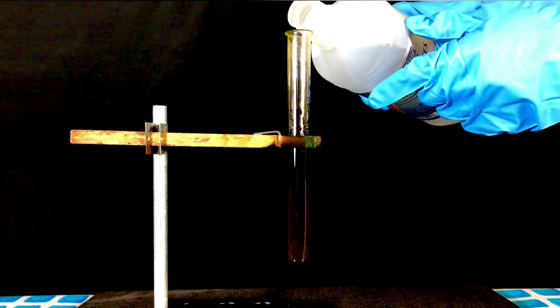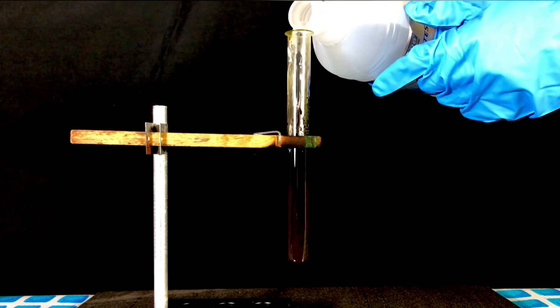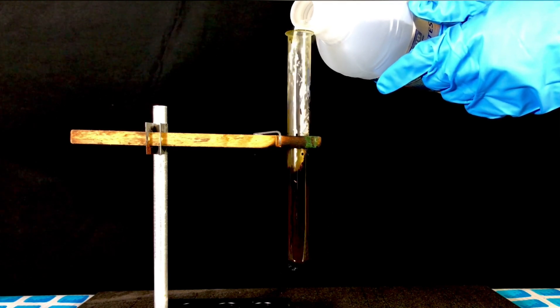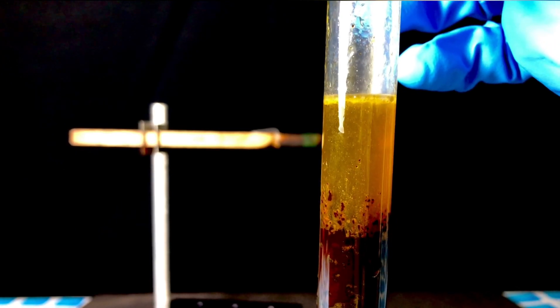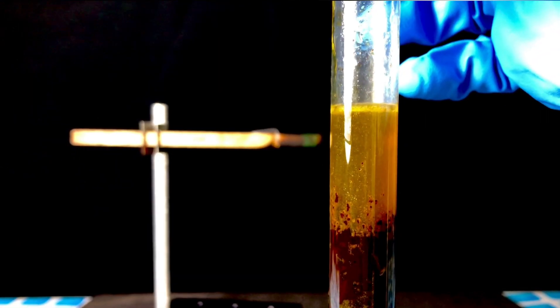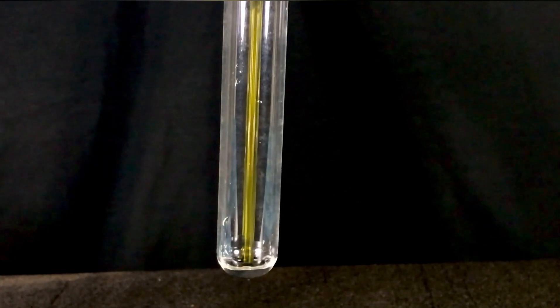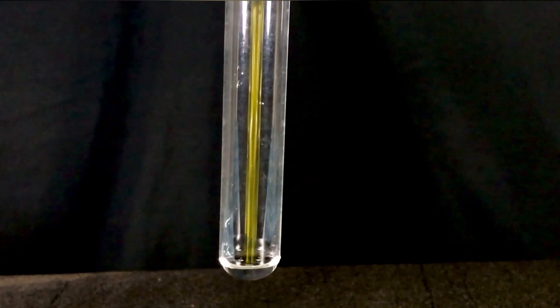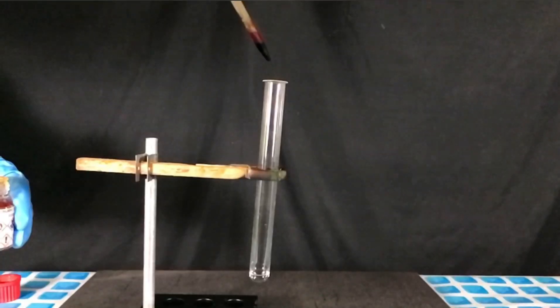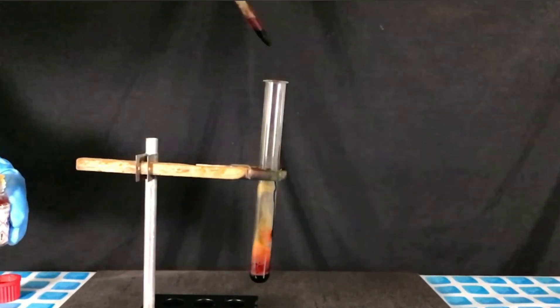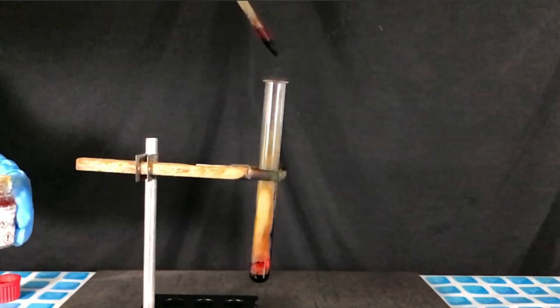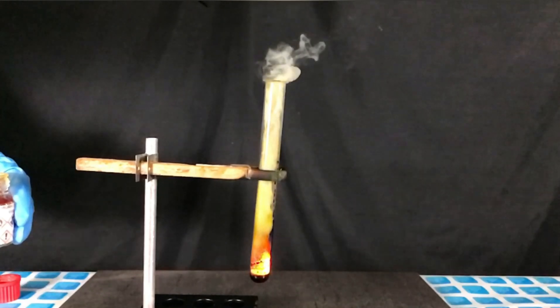A small amount of distilled water was added to hydrolyze the complex. This should yield a small amount of benzaldehyde. The test tube was shaken and left to stand for 2 minutes. Afterwards there were small droplets of what was hopefully benzaldehyde floating to the top. For the next reaction we added diethyl ether to the test tube. The ether soon caught on fire but it wasn't as spectacular as I hoped so we will have to try even more reagents.